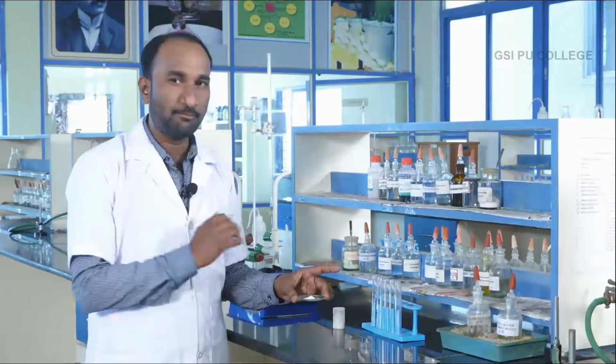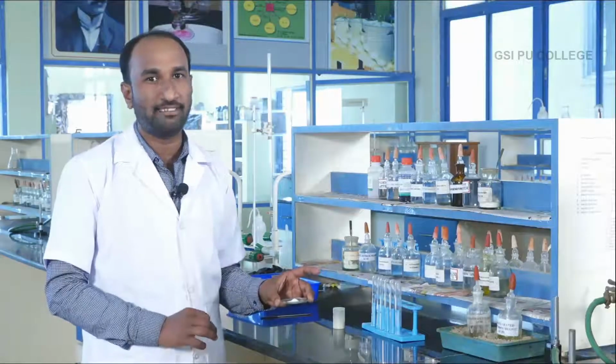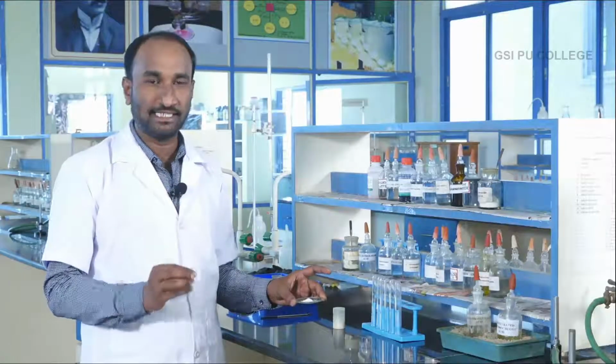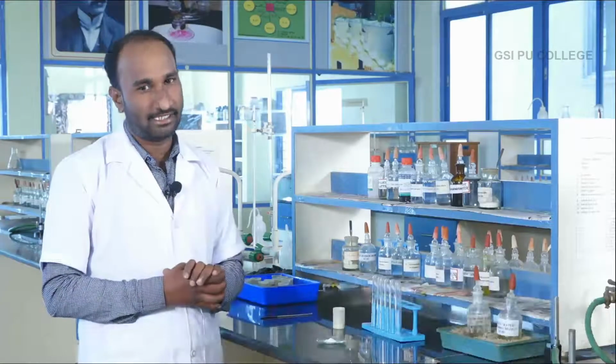Good morning students. Today in the practical class we will discuss systematic qualitative analysis of a simple inorganic salt. A simple inorganic salt contains one acid radical and one basic radical. You can detect the acid radical and basic radical by systematic analysis. The first step of analysis is the preliminary test.